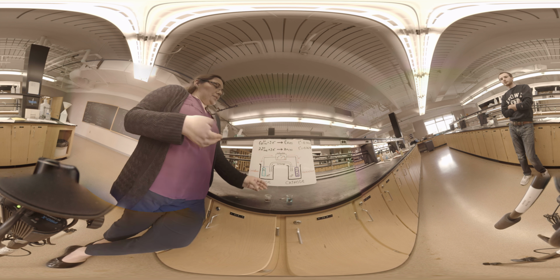If we look at this reaction 24 hours later, this is what happens. So you can see the solution lost the color. That means copper 2 plus is not in solution anymore, because all the copper 2 plus was reduced to copper zero. And you can see at the bottom here, this orange solid, that's the copper zero. And the zinc went from zinc 0 to zinc 2 plus, and it's in solution, and zinc doesn't have any color in solution. So that's why our solution is transparent here. This process is spontaneous, as you can see.